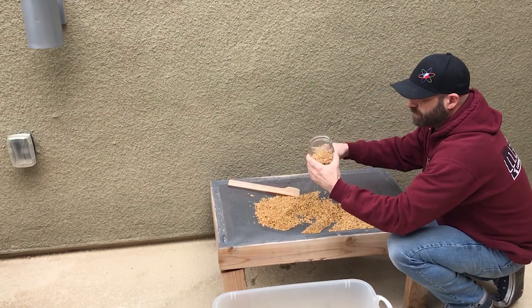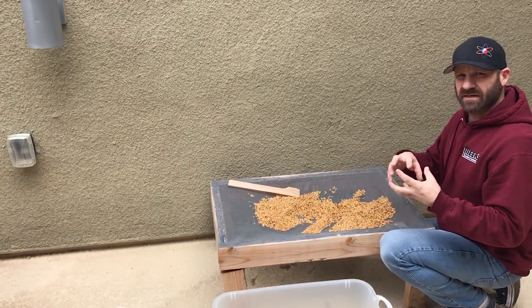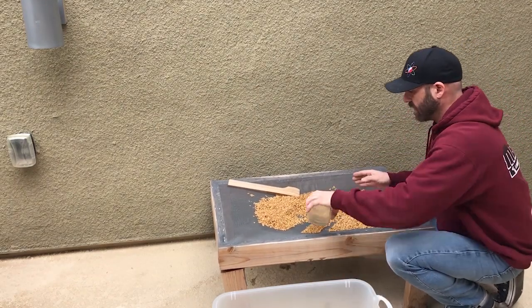This is the grain that sat for 24 hours in just water. I fill my jars up about three-quarters of the way so there's room when the mycelium starts to take over - you can still give it a shake and there's room for the grain to expand. So I don't go all the way to the top.